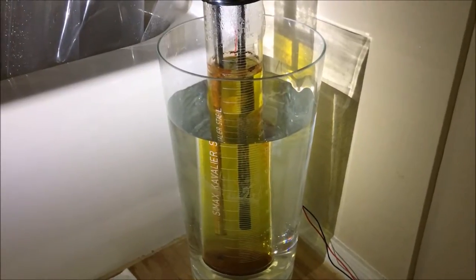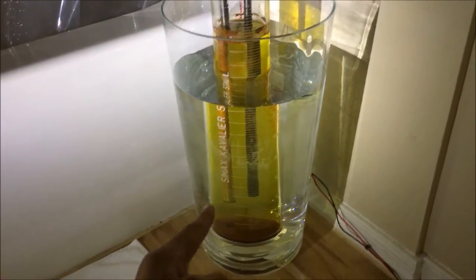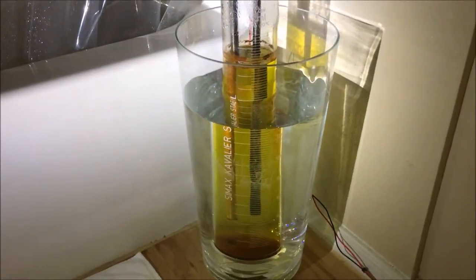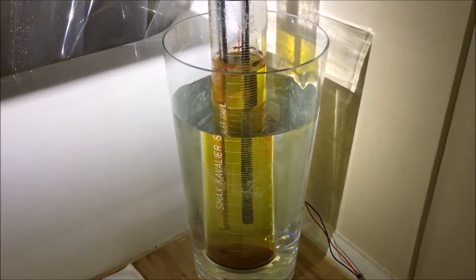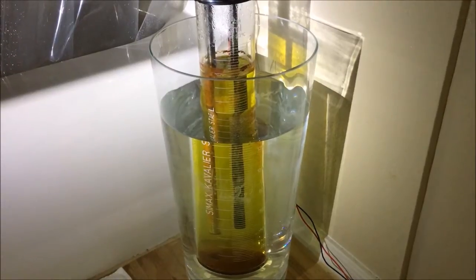Now, when I got here, it was obviously in a terrible condition, and this is actually not how I found it. It had about 3 inches deep of this oxide material. Last night I went through and filtered off the precipitate and then took a Brillo pad and scrubbed the oxide off of the anode all the way down to the metal.